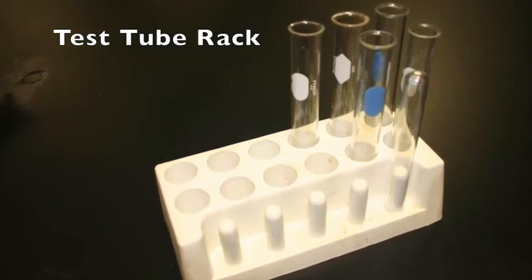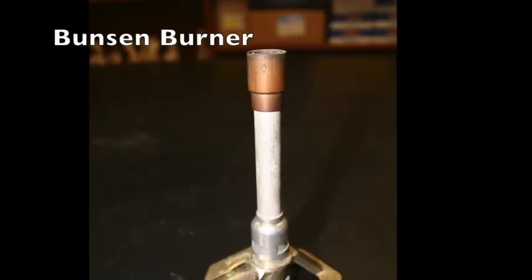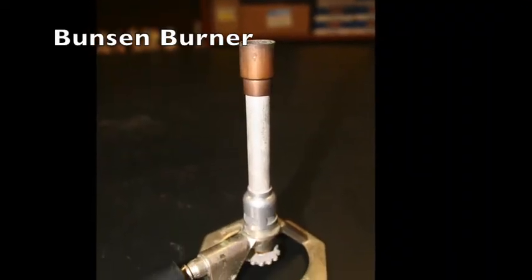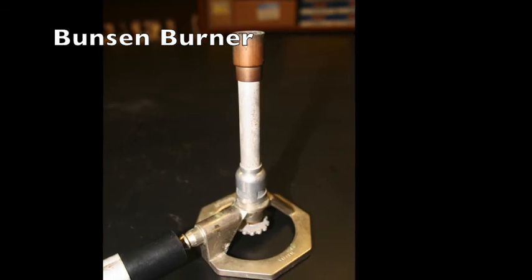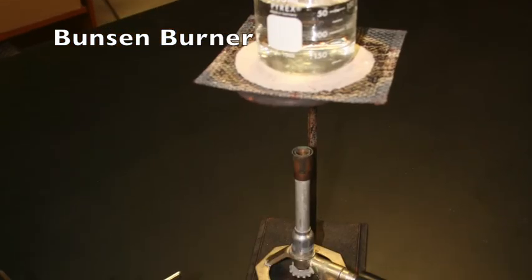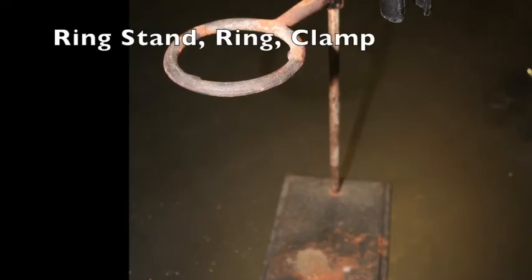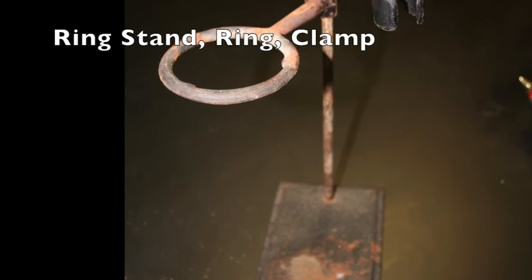Test tubes can also be cleaned and turned upside down to allow them to dry. The Bunsen burner produces a flame for heating or burning substances. The hose connects the burner to the gas outlet jet. Take care to tie back hair and to not reach over a flame. The ring stand provides a stable platform to which equipment may be attached.